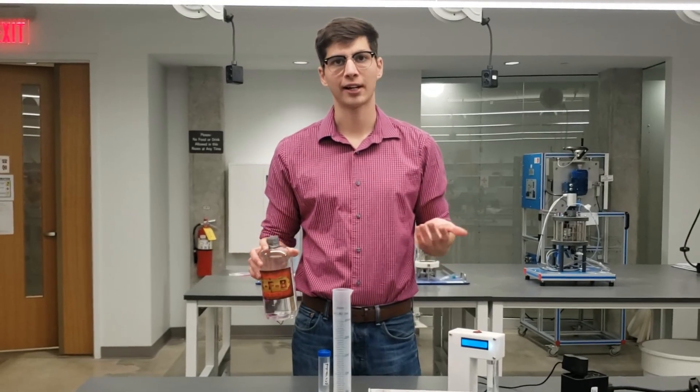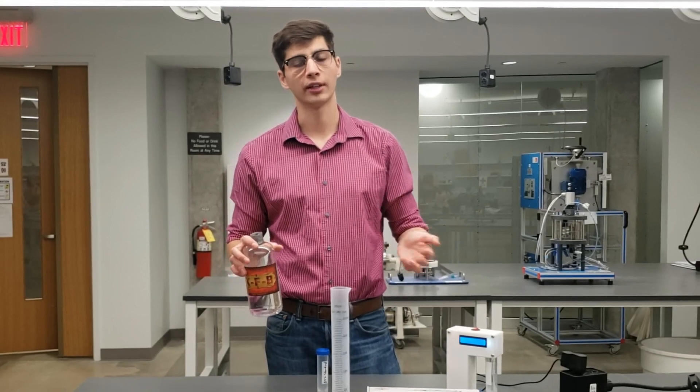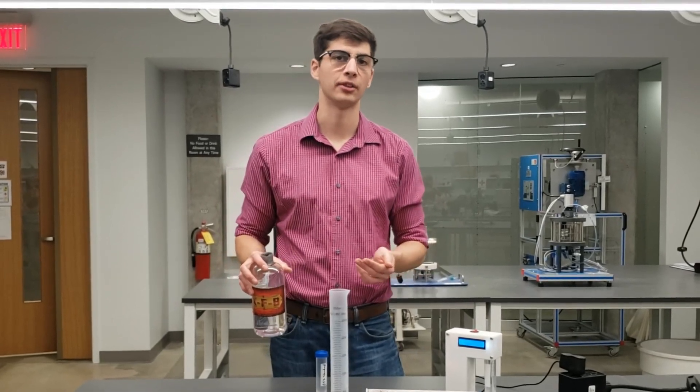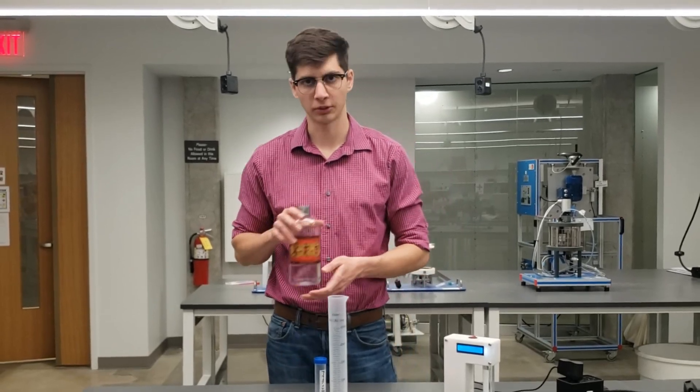So I'd recommend getting the 200 proof if you can. The Everclear is the second best option and then a high proof liquor would be the third best option, and your dilution factors will change depending on the alcohol percentage that you're using.